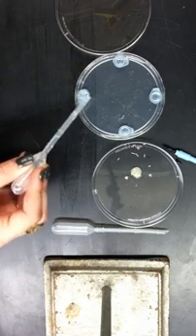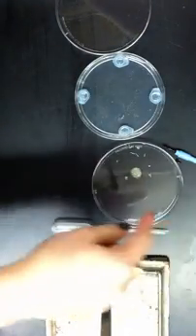Once you fill in the holes with the AM dilution, you're going to transfer the larvae that you just isolated and put them in the center of the plate using the paintbrush.